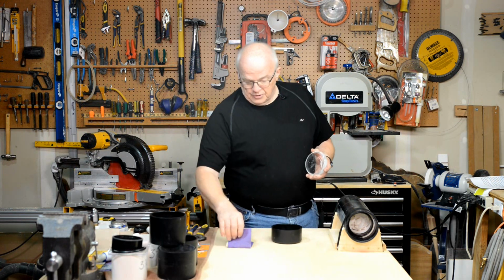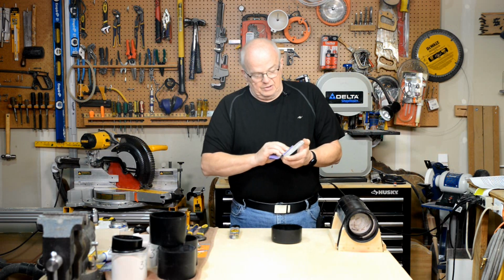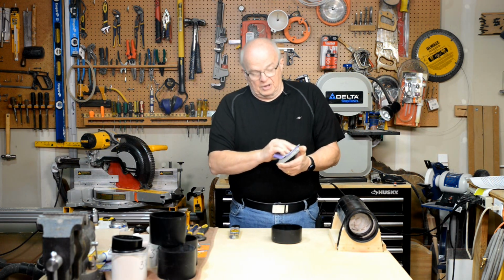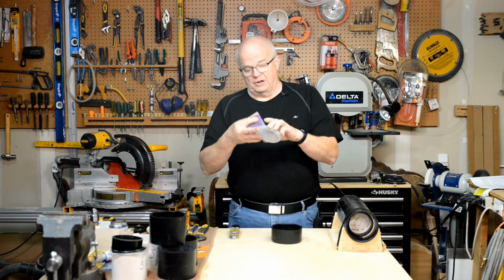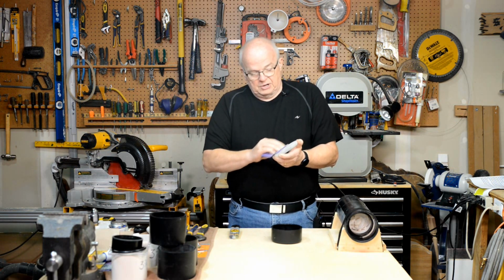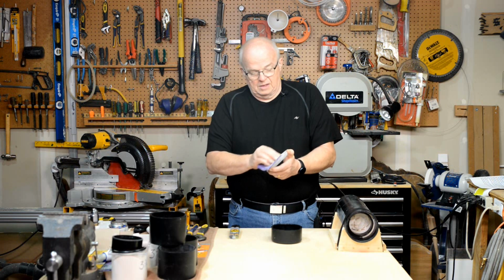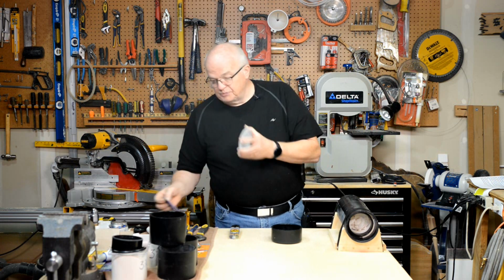But the first thing you want to do is take a piece of sandpaper and rough up this surface of this acrylic, okay? The part that's going to go down. It'll make for better adhesion. Don't have to be a lot, just kind of rough it up a little bit. Then turn it over and do the same thing to the other side, and I'll explain why later, because there is going to be some acrylic put on top of this too. So rough up both sides of that. There, that should be plenty good. Blow it off and you're good.